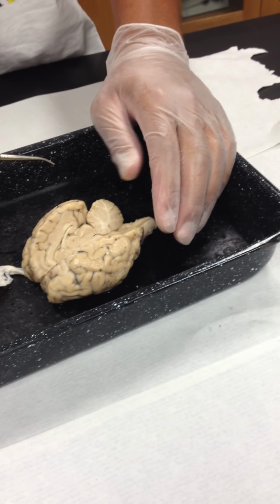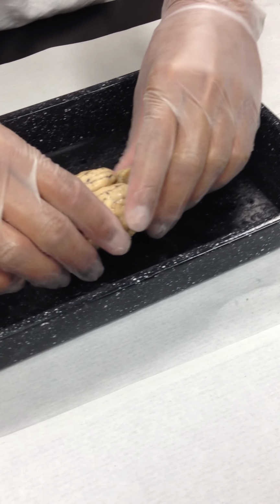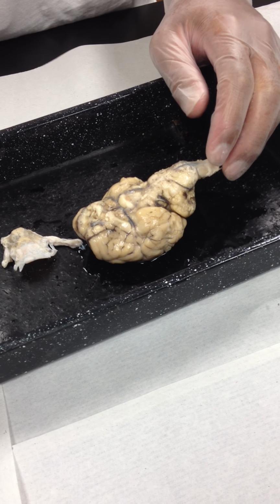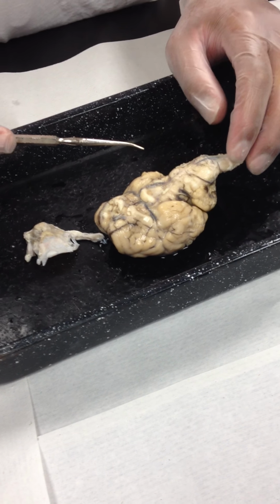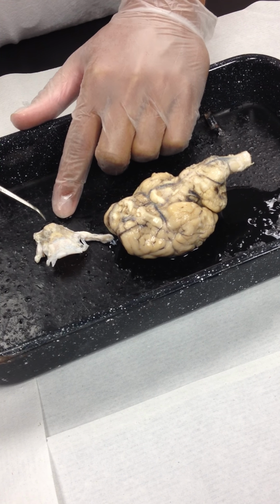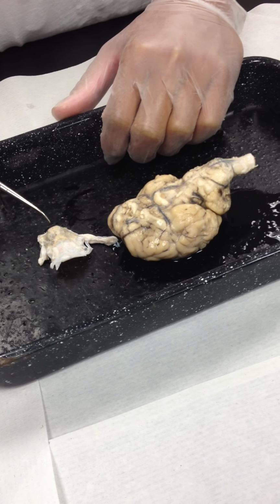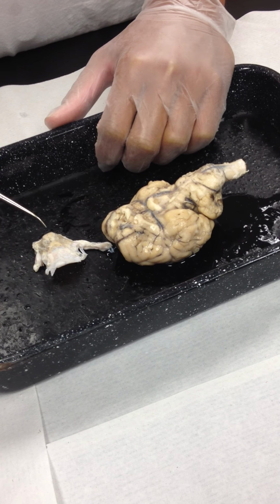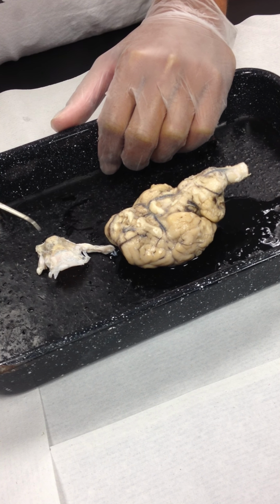In addition, from the outside, we can see the pons and the medulla. I'm going to flip the brain over so that we can see those structures on the lower portion here. Looking at an inferior view of the sheep's brain right now. The pons at this moment is partially covered by this membrane. That's the pons right here. And just behind it, this other enlargement area right here until it turns into the spinal cord and continues on out, this region would be the medulla oblongata.